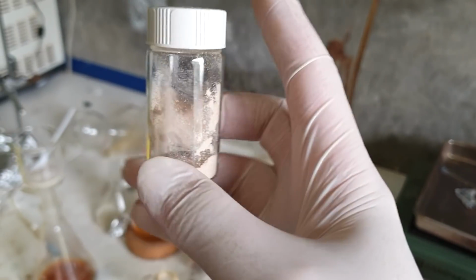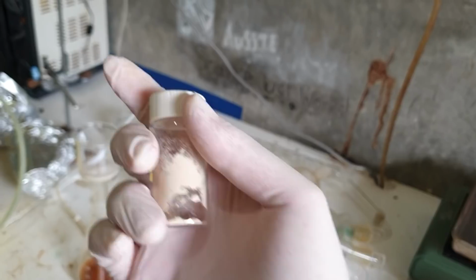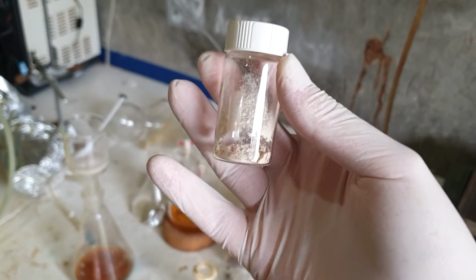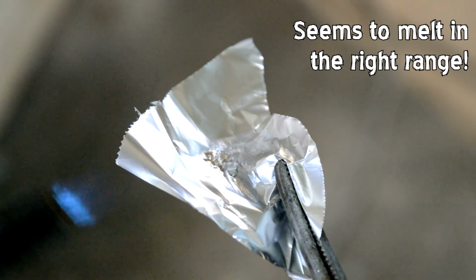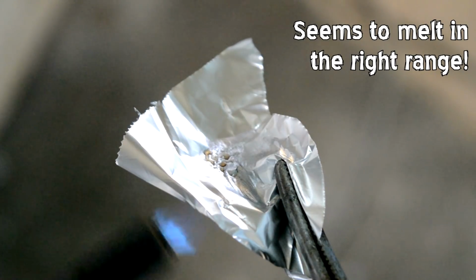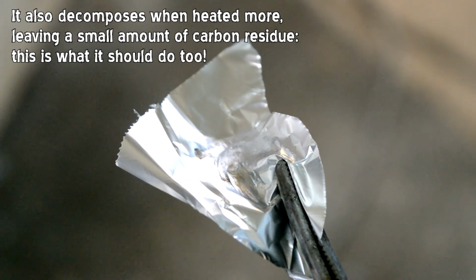In terms of confirming what it is, we can do the world's crudest melting point test. We know the product we started with has a melting point of about 78, and this, if it is our product, should have a melting point of about 170 odd. And if it's all just sodium bromide, which is our other byproduct from the reaction, it'll have a melting point of about 782. So I'm just going to heat it with a bit of a light flame. And if it melts, that's roughly in our right range, because that sort of flame temp should melt something about 200 pretty easily. But not so easily that we see that it's an 80 degree melting point thing. But if it's just sodium bromide, it won't melt at all. But yes, like I said, world's crudest melting point test.